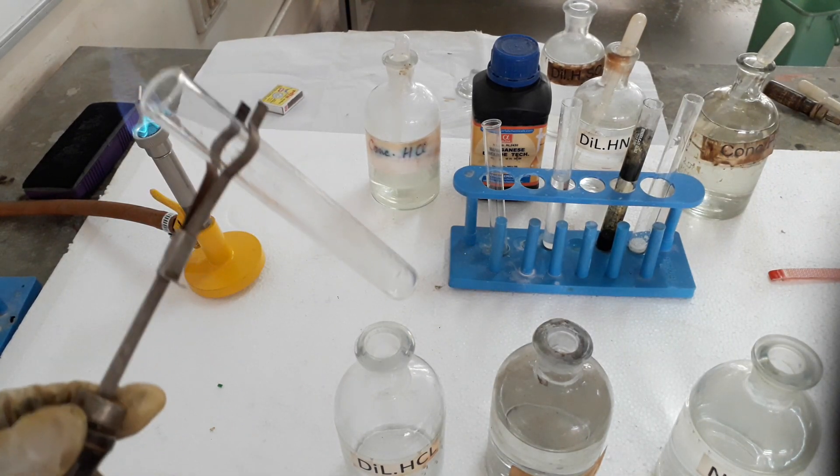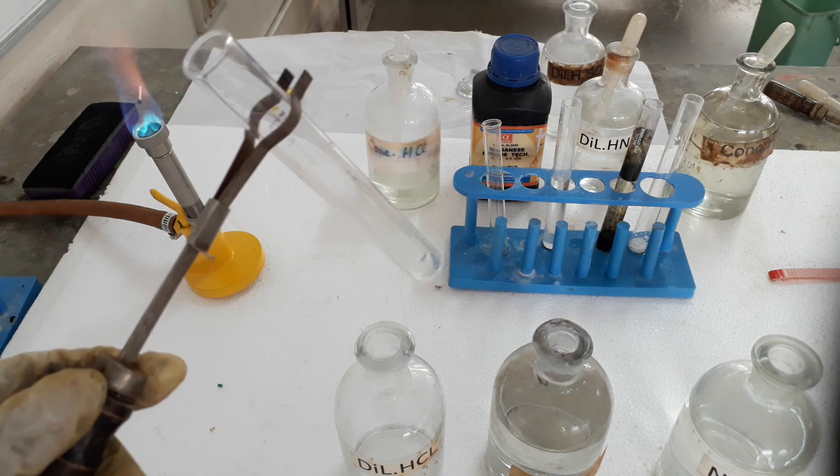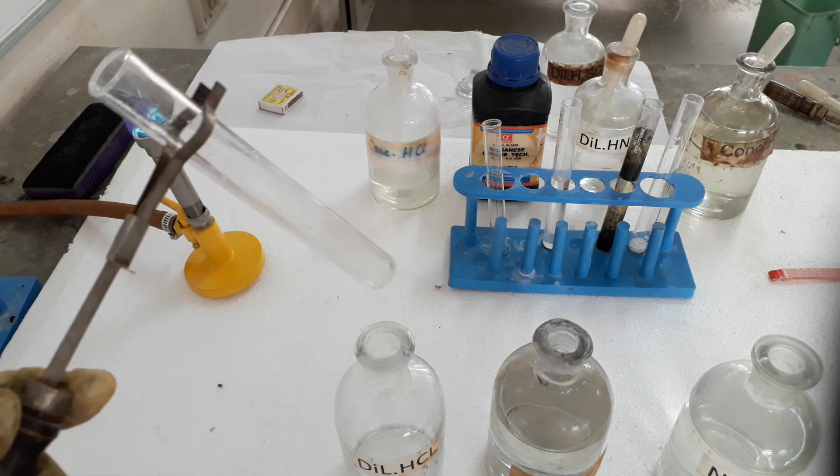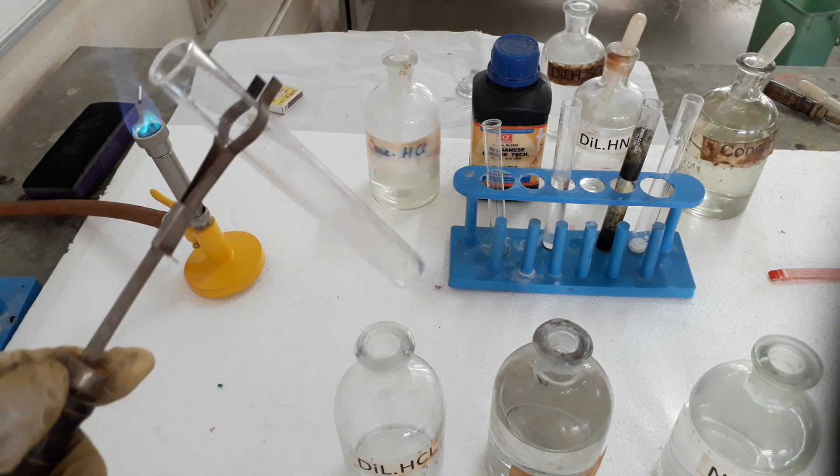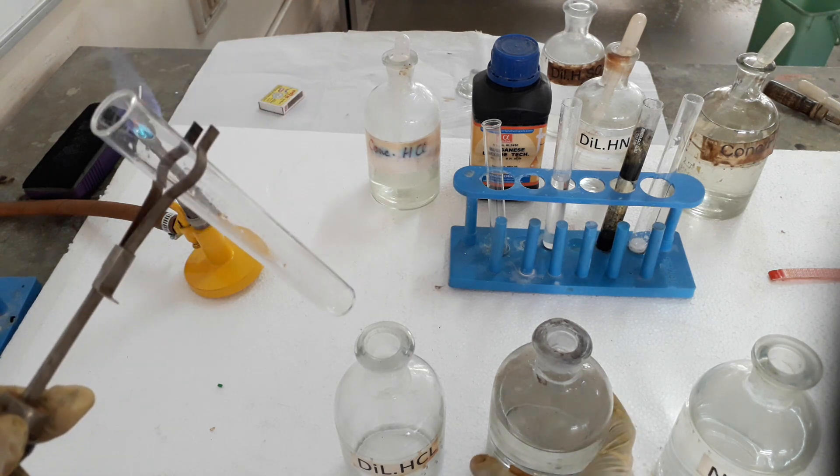Hello students, I will be showing you the dilute hydrochloric acid test.